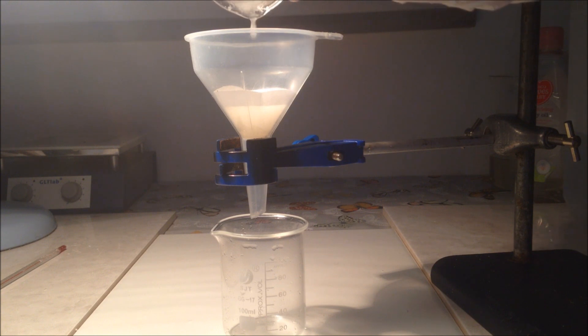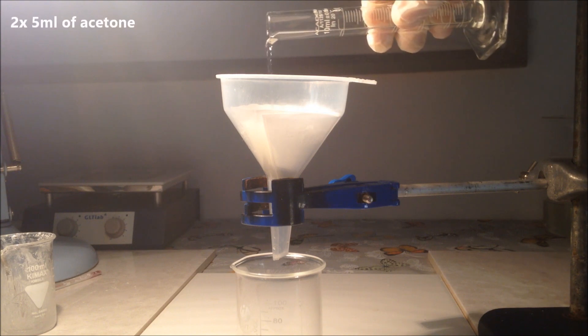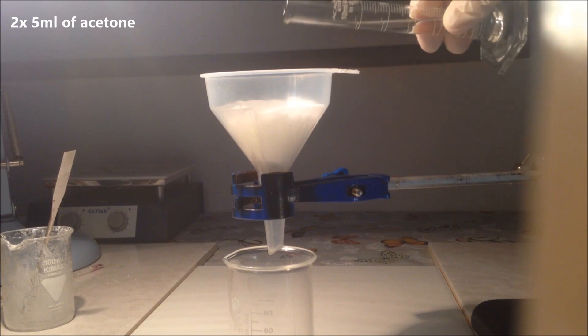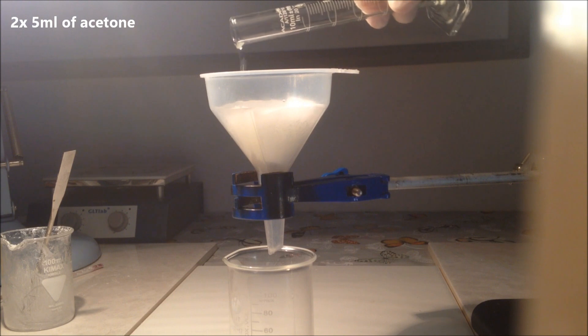I then went on for a gravity filtration, as you can see. You can just go for a vacuum filtration if you're up for that, but my equipment annoyingly only came a little while after.